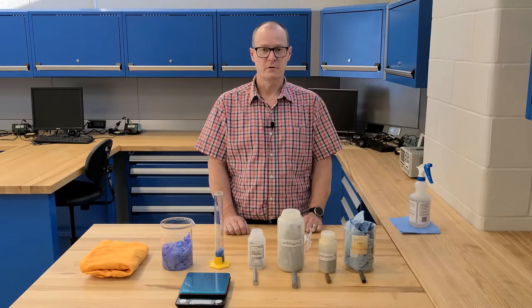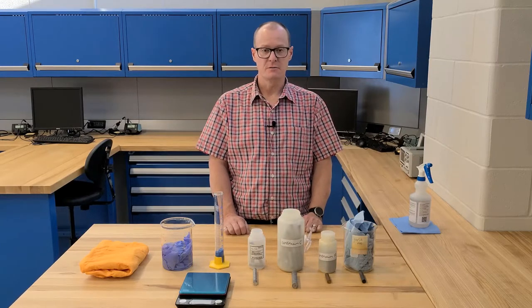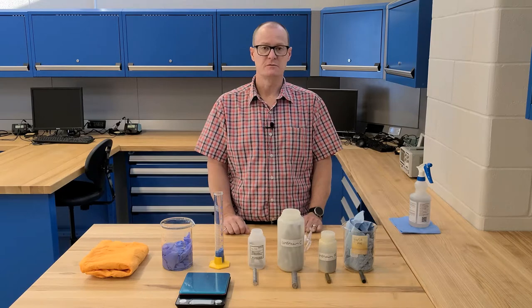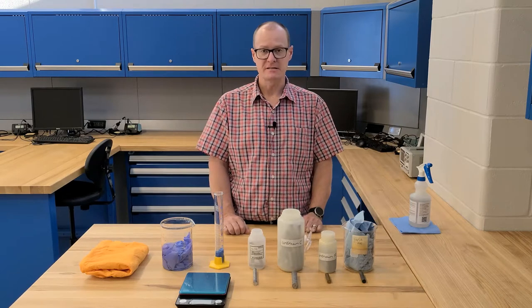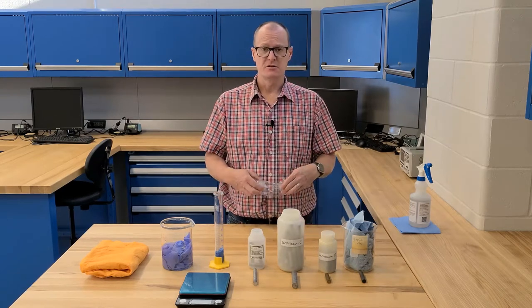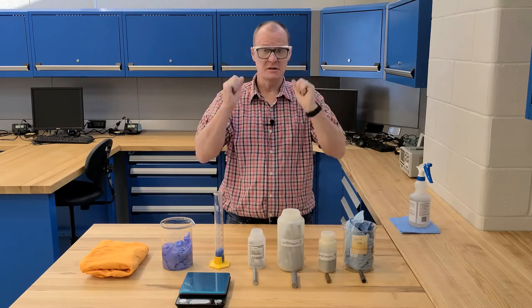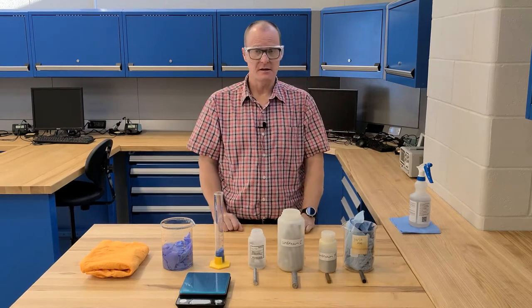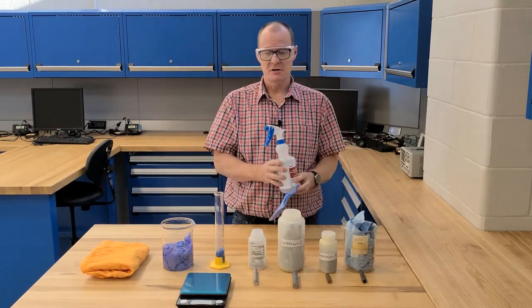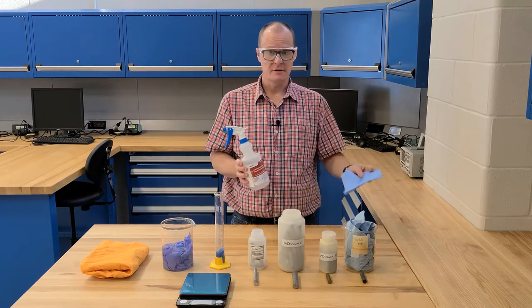In this experiment, we're going to be using the mass and volume of various samples to determine the density. Before you begin, please ensure that you have your proper PPE including safety glasses and anything else that your instructor requires. Please make sure to clean and disinfect all equipment before you begin.